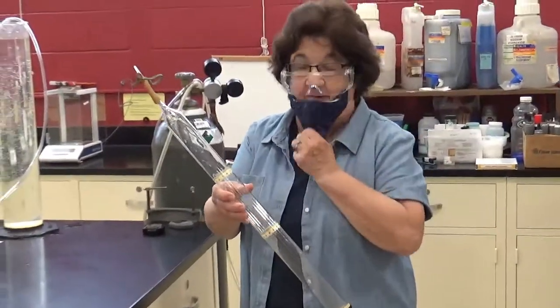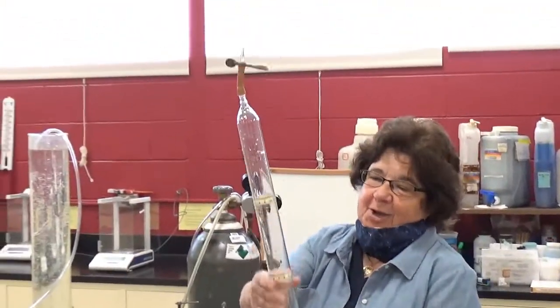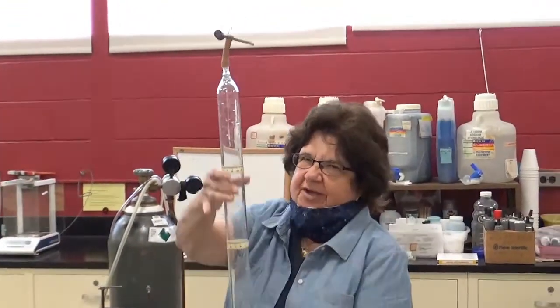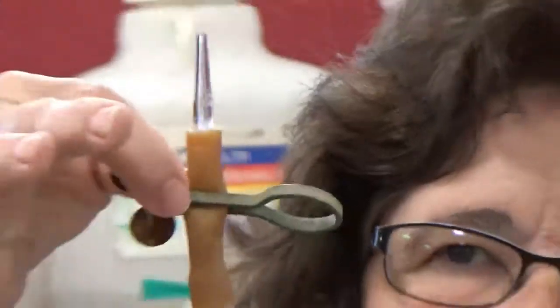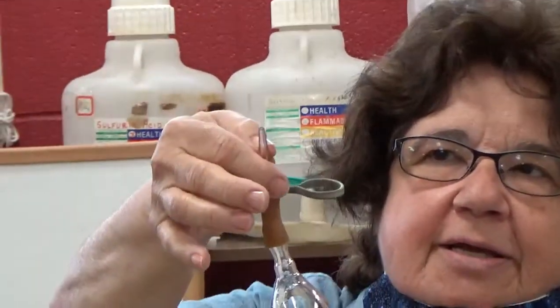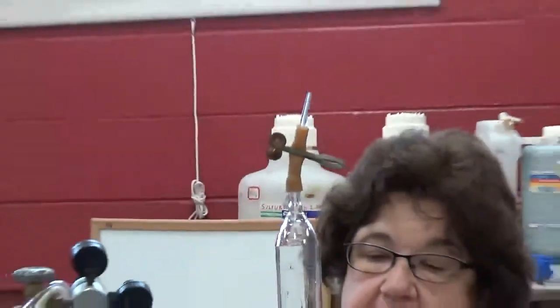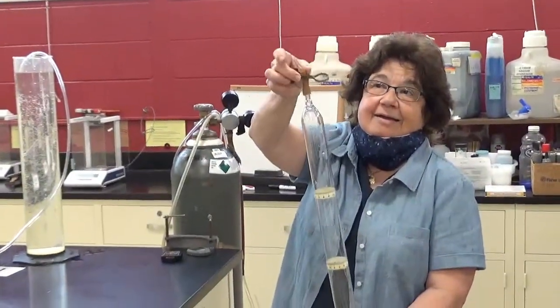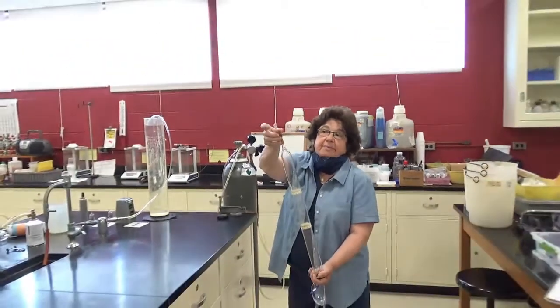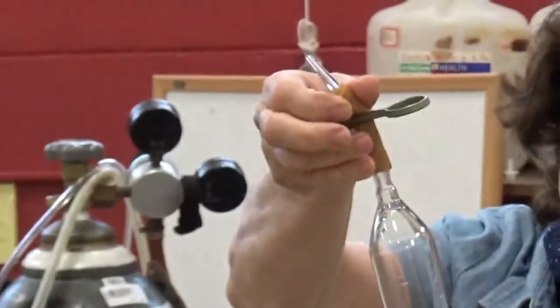Now you'll see what we have here is a long tube, pretty high-tech stuff, okay? It looks sort of like a graduated cylinder, and then we've got a little tip here with a piece of rubber tubing, and a little clamp that cuts off the rubber tubing from the air. We also have a tiny tip here, like a burette tip. What we're going to be doing is putting some gas in this tube, and letting it leave this tube by this tiny little opening, okay?